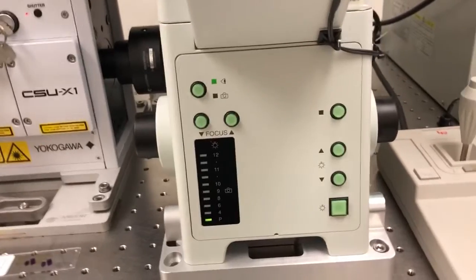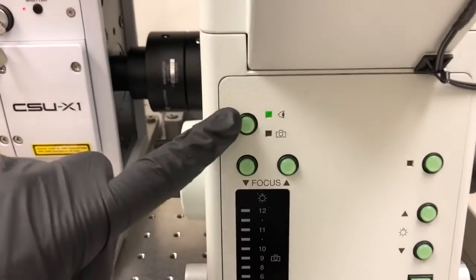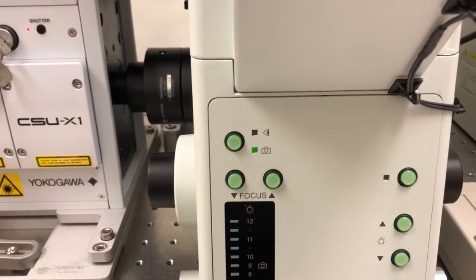Finally, we need to make sure that the light can go to the cameras, which are on the left of the system, as opposed to the eyepiece. So we're going to press this to make sure the light can go to those cameras.